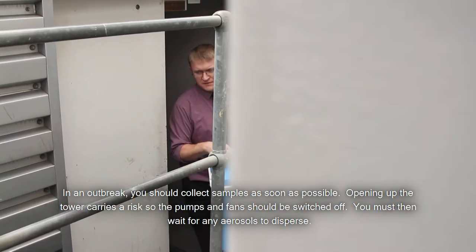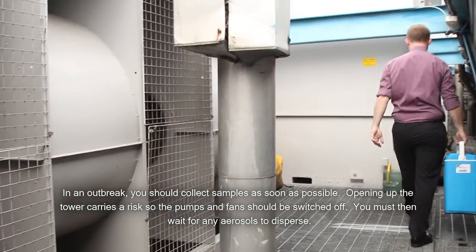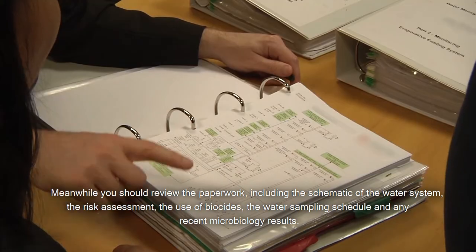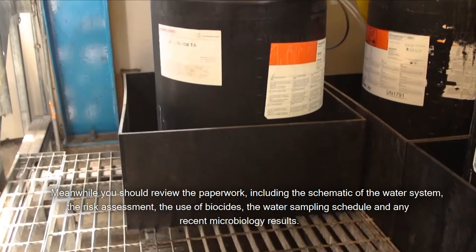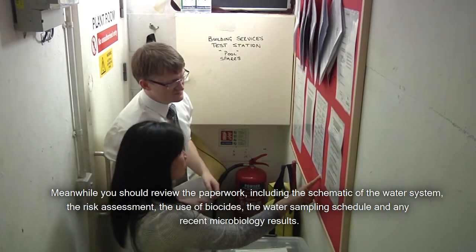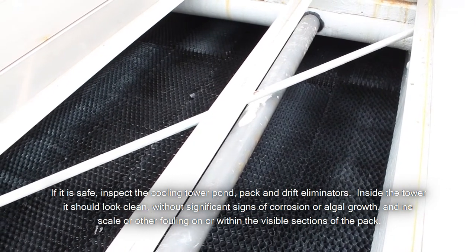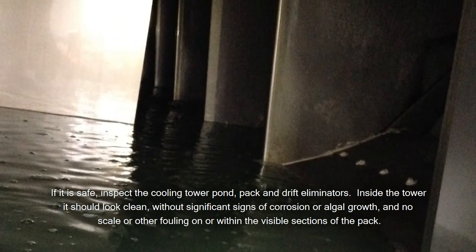In an outbreak you should collect samples as soon as possible. Opening up the tower carries a risk so the pumps and fans should be switched off. You must then wait for any aerosols to disperse. Meanwhile you should review the paperwork including the schematic of the water system, the risk assessments, the use of biocides, the water sampling schedule and any recent microbiology results. If it is safe, inspect the cooling tower pond, pack and drift eliminators.